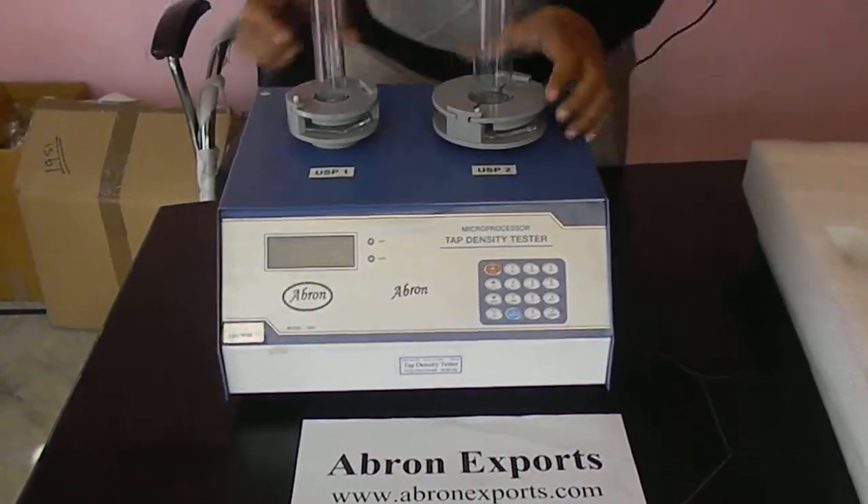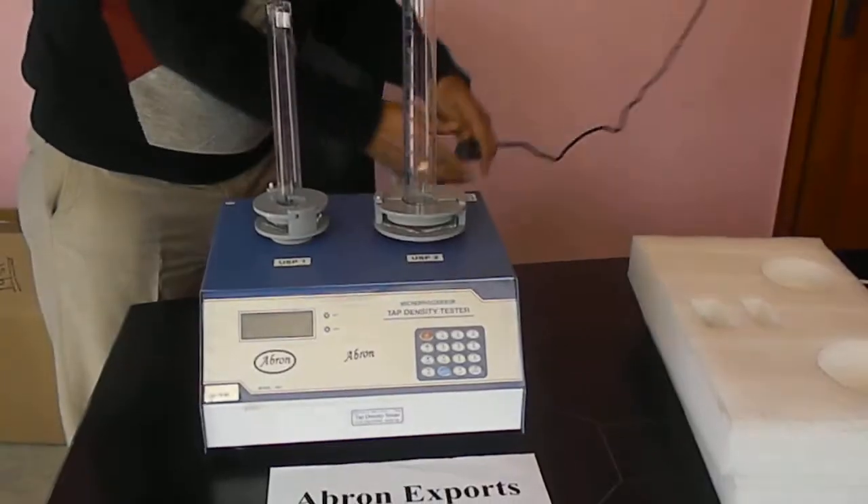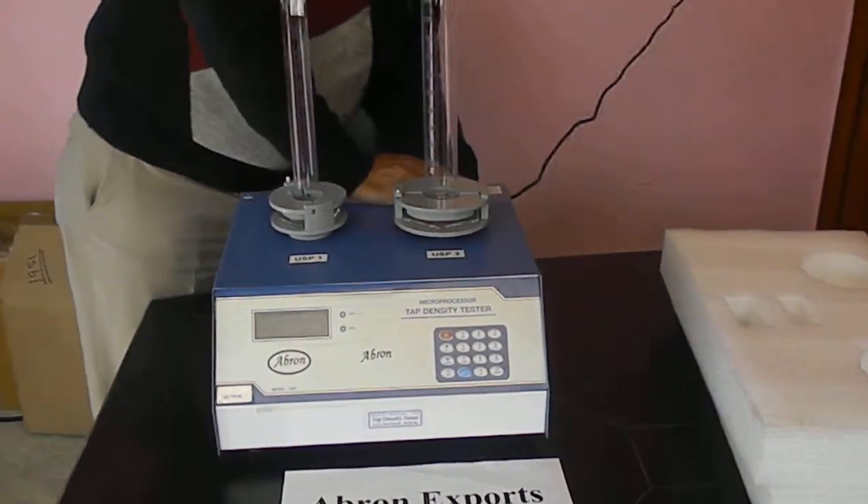You can keep it outside. Now this is moving. We connect the power wire on the back and then switch it on.